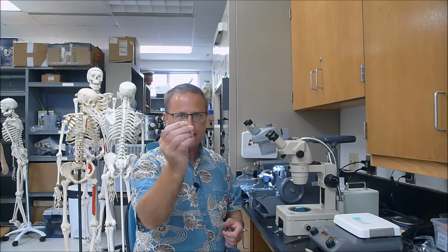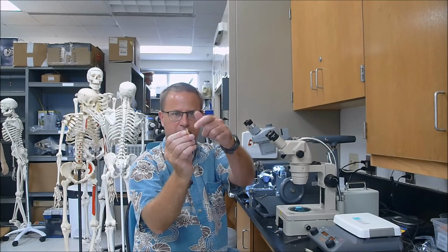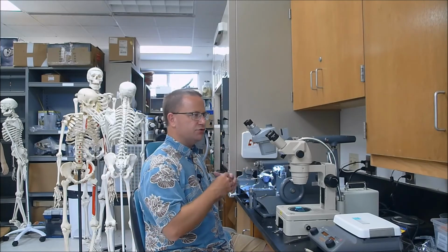Okay, so after preserving our specimens, we then put them through a graded alcohol series and eventually a resin series until we dehydrated them, we had them in resin, we eventually embedded them in a resin block that looks something like this. So that contains our hot dog tissue in there, and we're going to section it on something called a microtome. Again, a microtome is just an instrument that we use to cut tissues very, very thinly so we can look at them under the microscope.